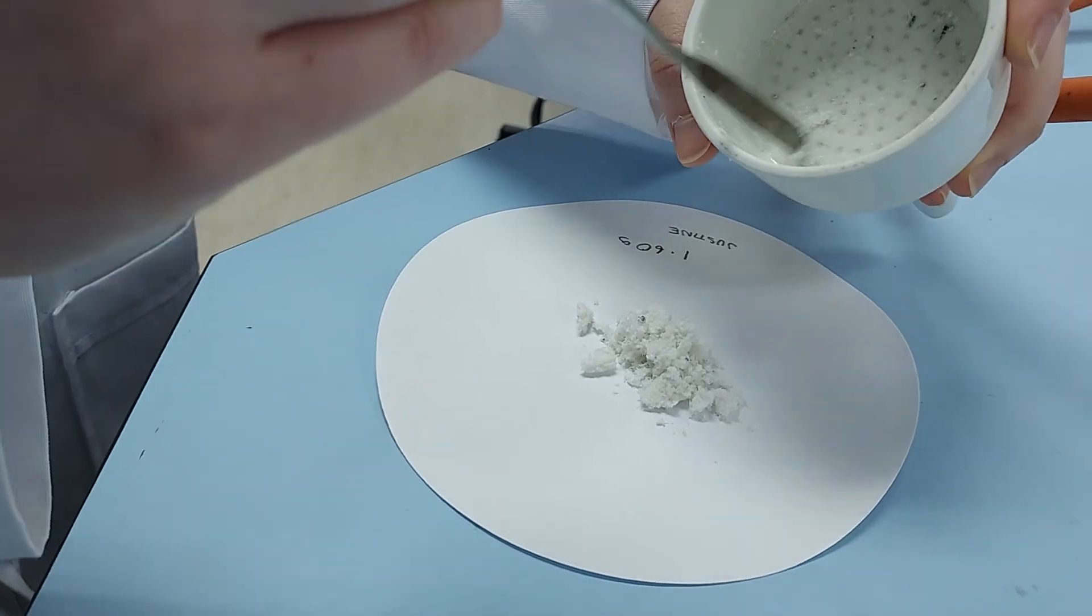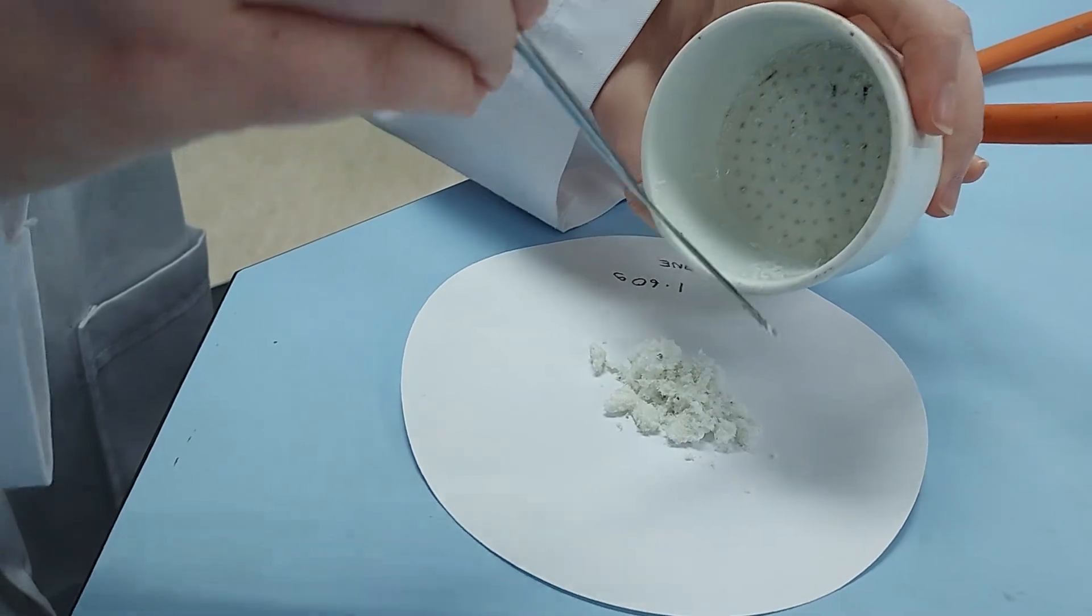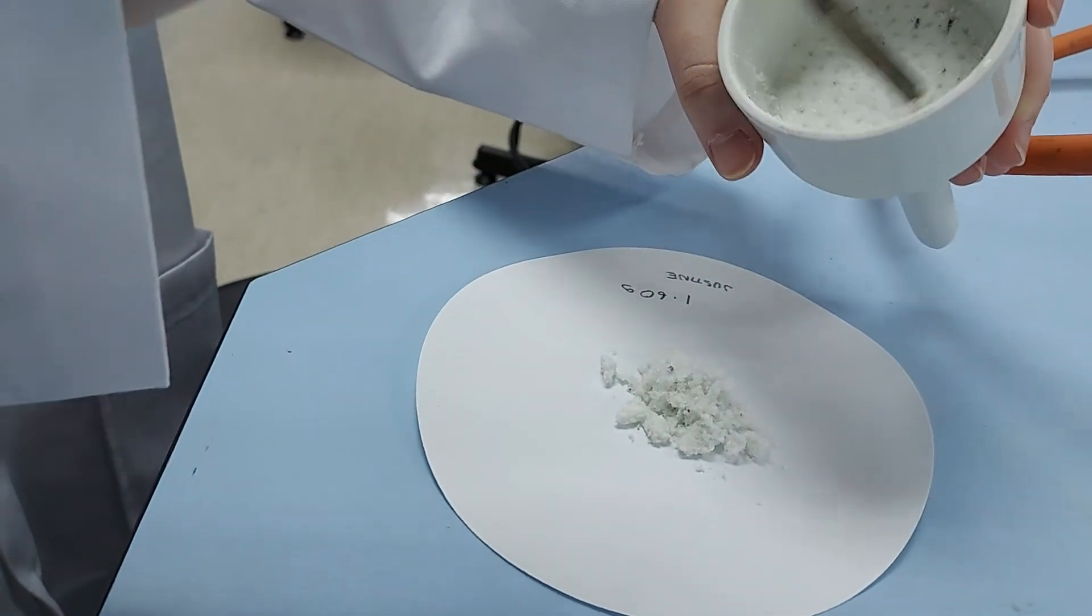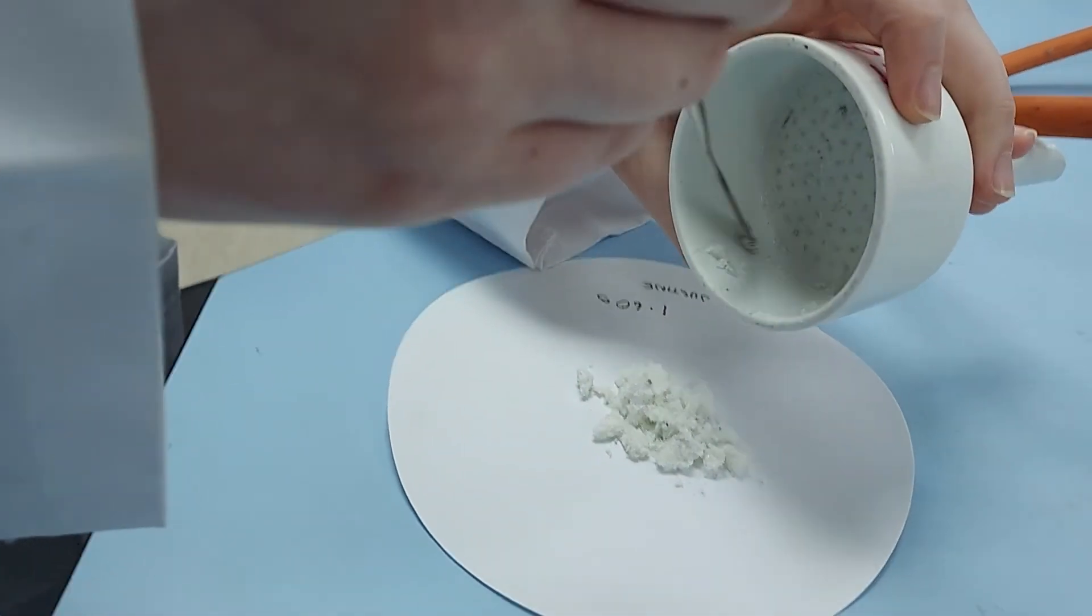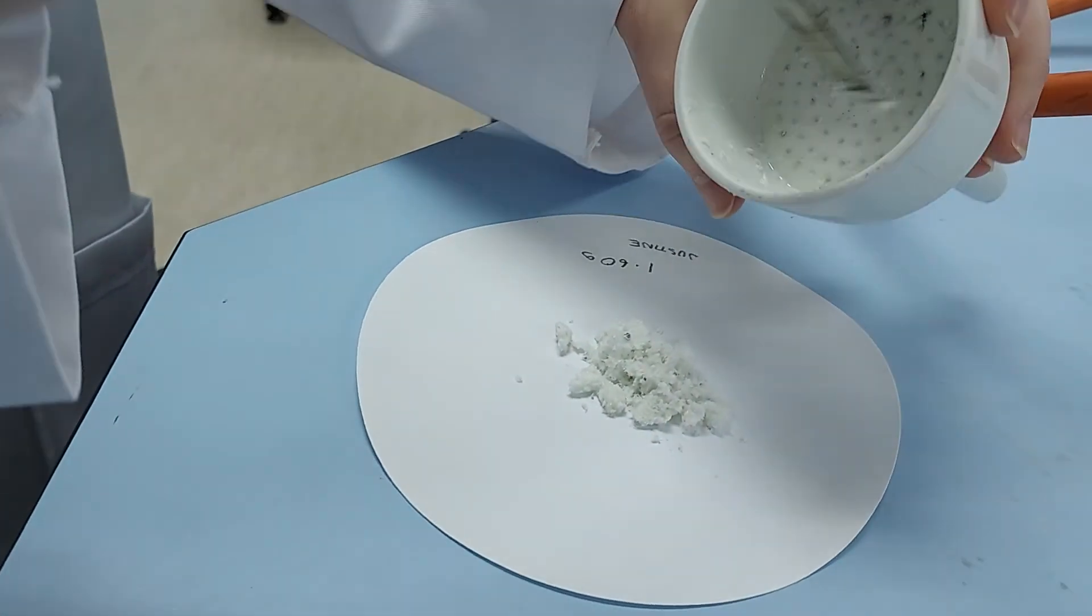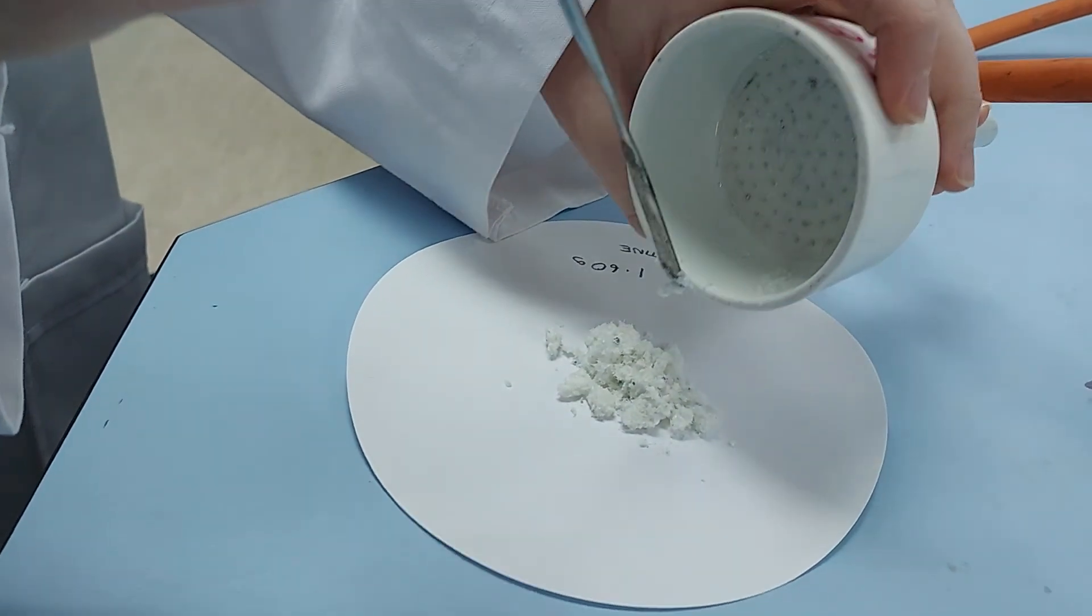The oven is set below the melting point, so the oven is set at 50 degrees. If we have a pure product, we should hopefully get a melting point of 77.5 degrees. We will perform a melting point using the melting point apparatus after this is dried overnight.